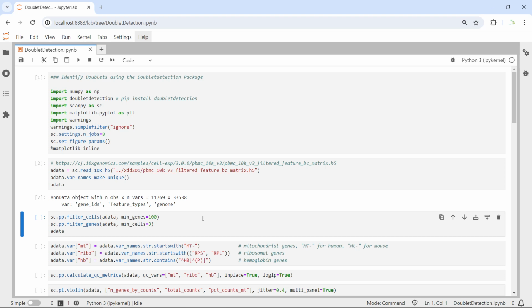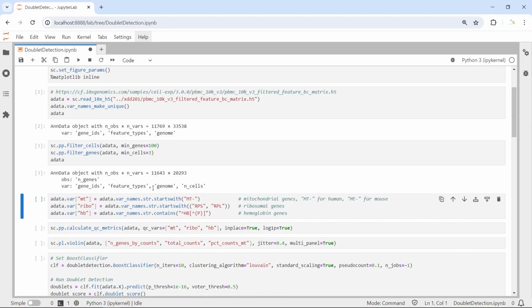So normally we perform 3 steps of quality control. First, we can filter out the cells that have detected genes lower than 100, and also we can filter out genes that are only expressed in 1 or 2 cells. So let's filter the data first. You can see after filtration, we only have 11,643 cells now, and we only have 20,293 genes. So in the next step of quality control, we can analyze the quality control metrics, then subset the data.